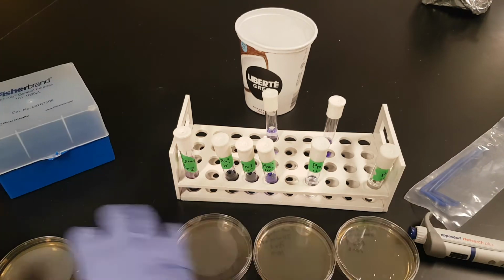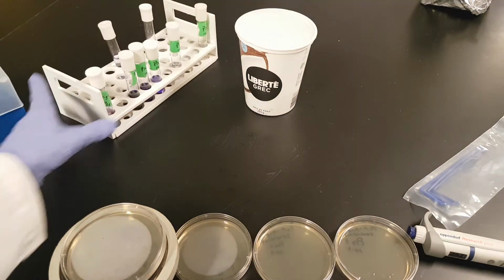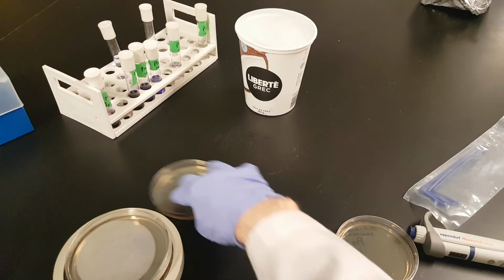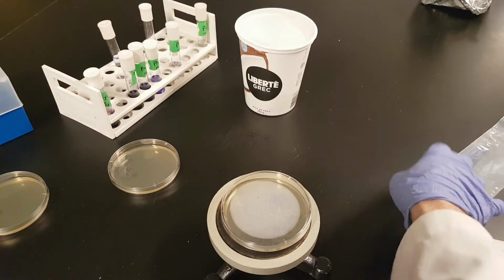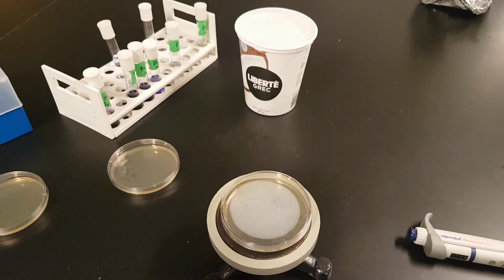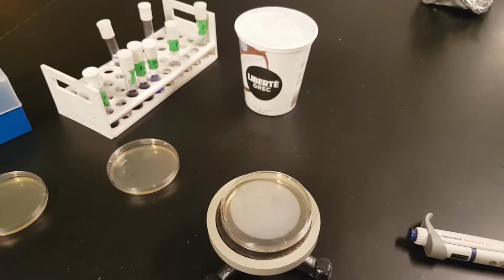Now to spread them. It's a spread plate. Of course, we're going to spread. Set everything else out of the way. Make sure that your plates are here. Now, if you are not sure that you'll be able to work quickly enough, you can do the plates one by one, put the sample on them, and then spread them. Might not be a bad idea. We are sort of pressed for time though, so we want to work efficiently.